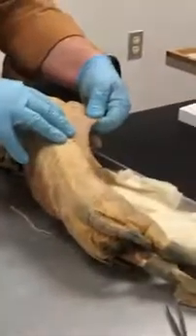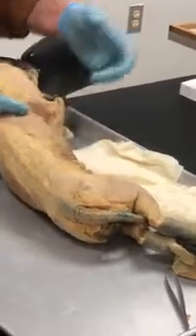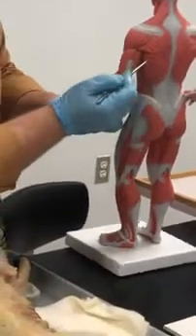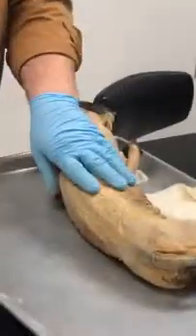This big muscle over here is called the latissimus dorsi. It's on the lateral and dorsal aspect, thus the name, latissimus dorsi. When people say, I'm working on my lats, that's what they're talking about. On a human, it's this one right here. That's the latissimus dorsi. See it? And one on that side. Okay? There is a trapezius on here.